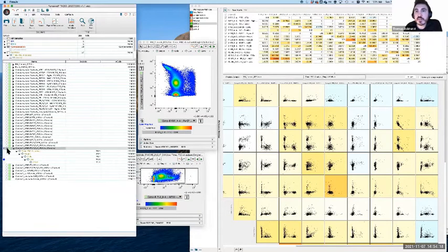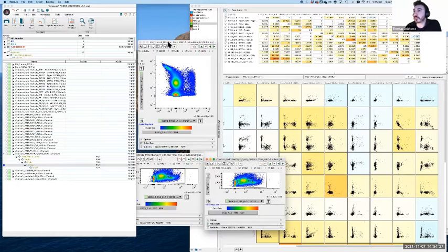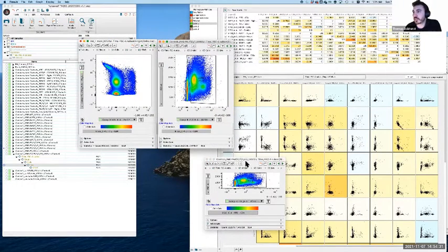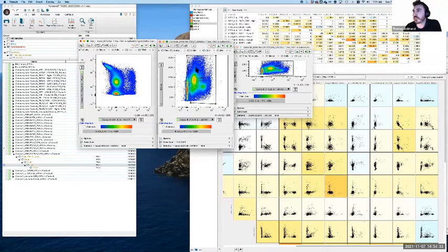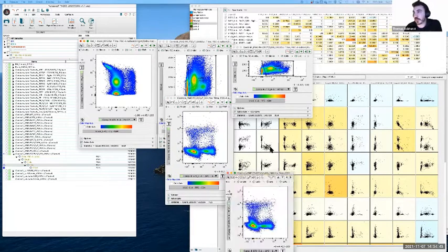And PerCP-Cy5.5. I've obviously done some prior gating here, so I'm just going to go for the live CD45 cells in this case. Oh, oops, I selected the live gate. This is the issue with doing this in multiple screens. We're so naive, like, no, multiple screens will be fine. It won't be a hassle at all. Okay, there we go.